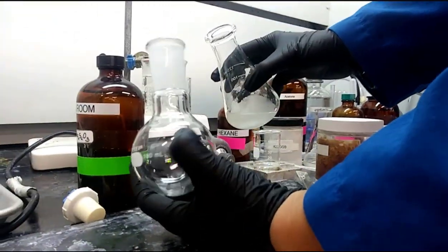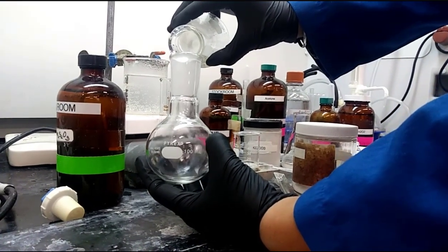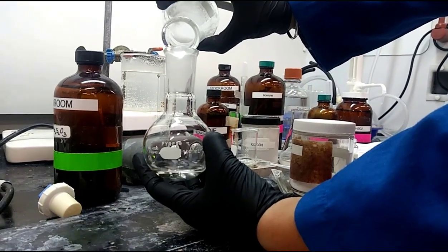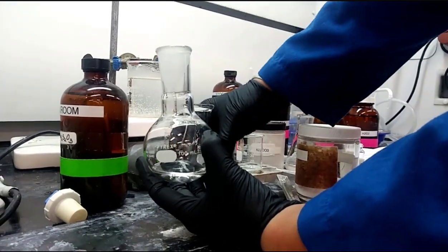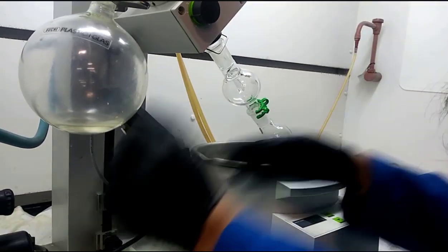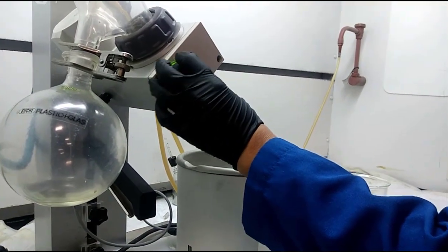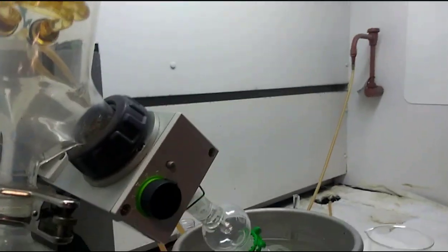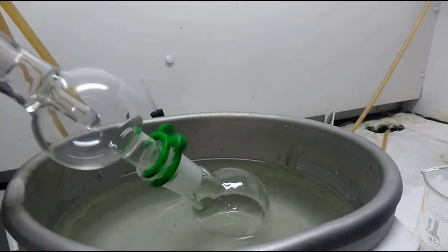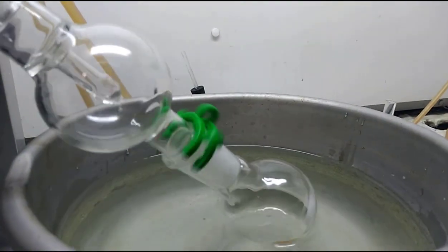And so now they're decanting the remaining solution, which should just have hexane and your alcohol. Now remember, this anhydrous sodium sulfate was very important to remove the water, because you are going to be looking at your alcohol product in IR, and water and alcohols both have OHs. So you want to know you got one over the other. Now that it's dried, they're using the rotovap.